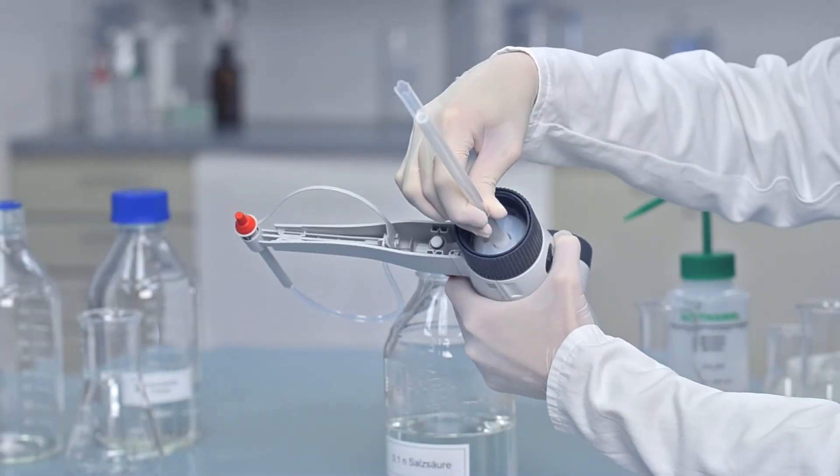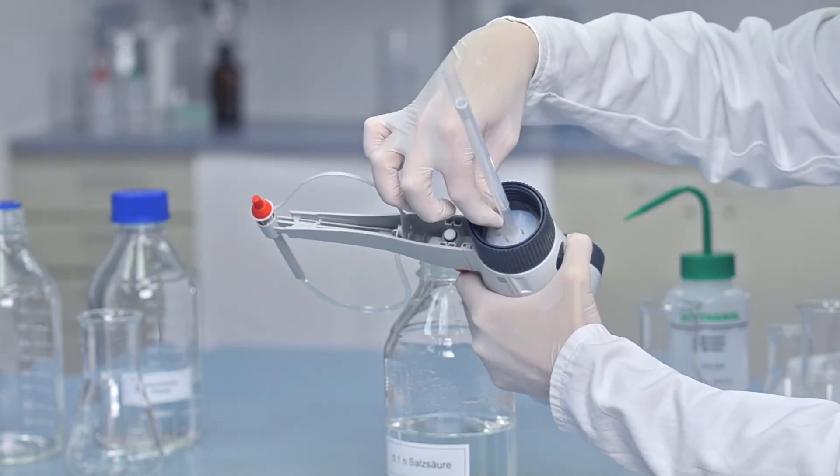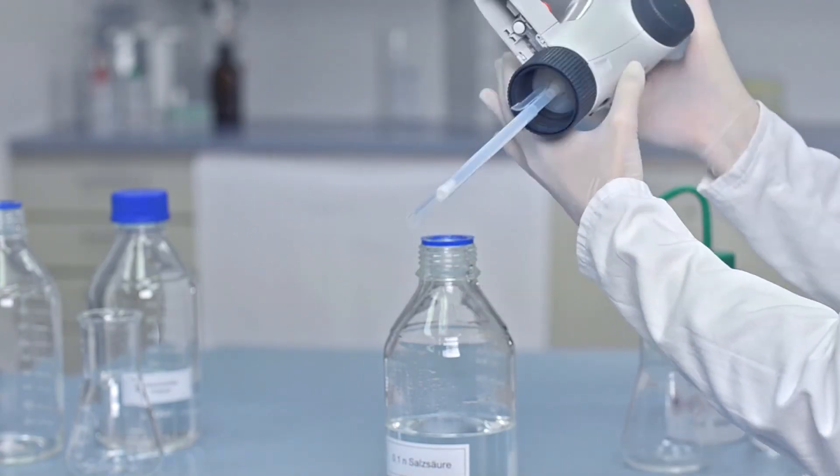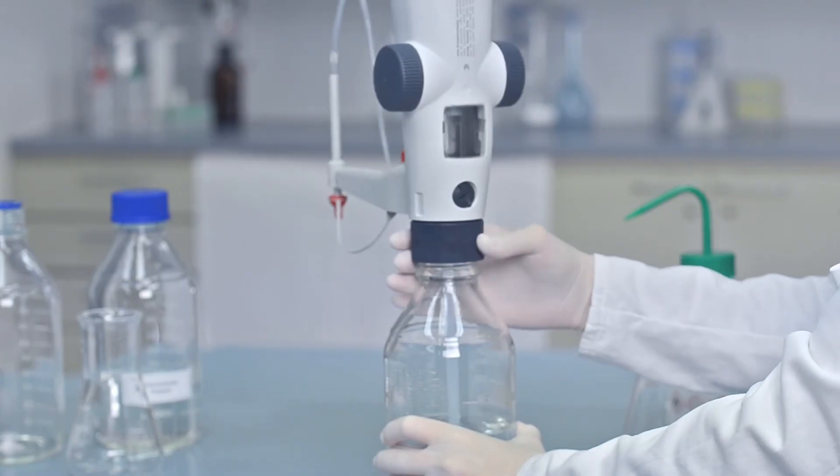Now mount the filling tube and recirculation tube, and then reattach the Titrette to the bottle.